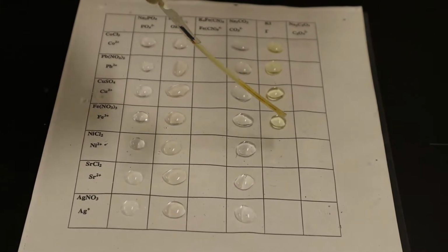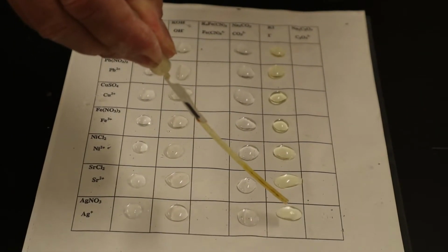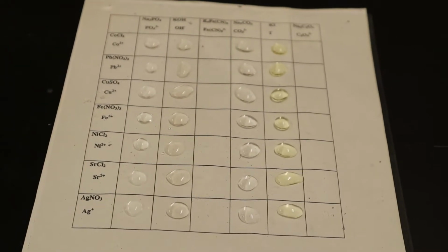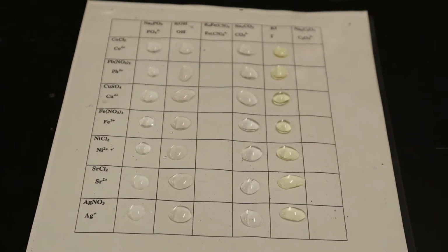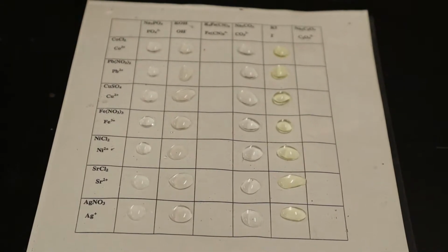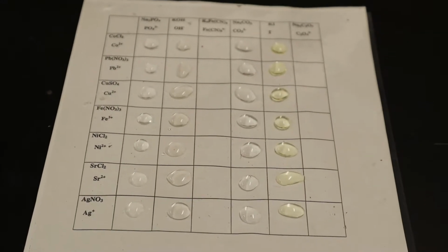Can you guys answer, what gives it the yellowish color? Is it the potassium or the iodide? That's a good question. I've always wondered that. I always thought it was the iodide, because it's a bigger atom. Usually it's the bigger atoms. And iodine is usually a brownish color, isn't it? Kind of bluish. The pure, yeah, or almost violet brown.